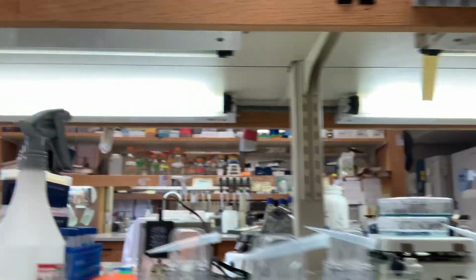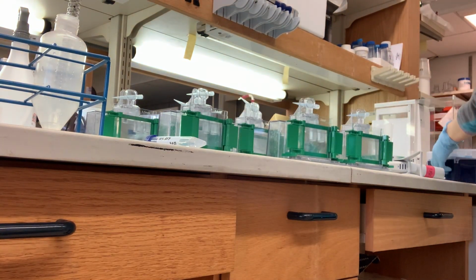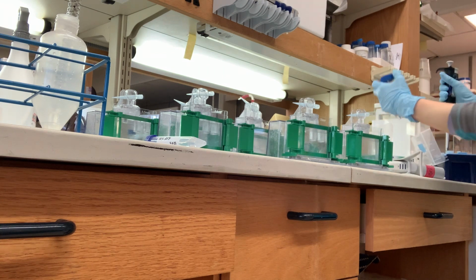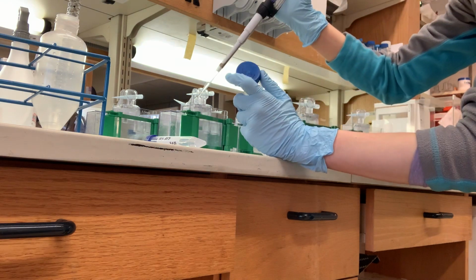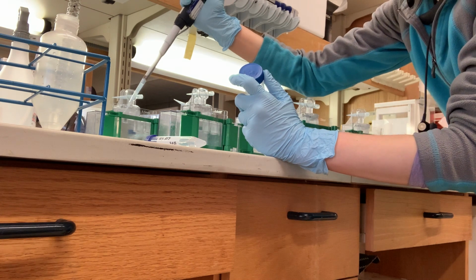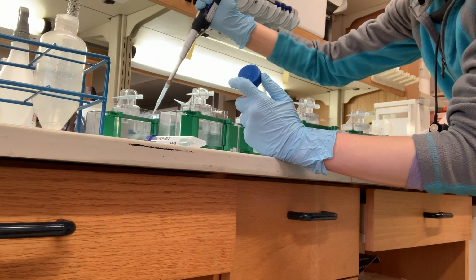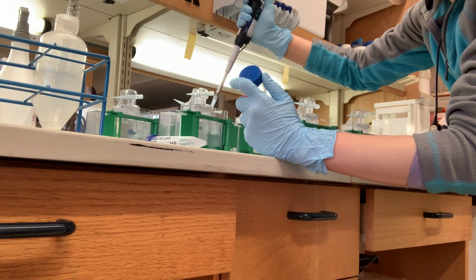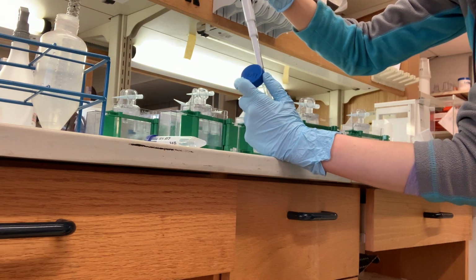So I think they're all okay. This one looks like it might be leaking. I'm not sure, but I spilled when I was making it. Now it's time to put the isopropanol layer on top to even out the top, create a nice line so you don't have it all wiggly. And then it'll also help prevent it from drying out. Before we add the stacking gel, we'll pour this off and rinse the top with water.